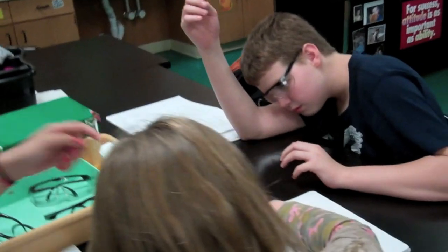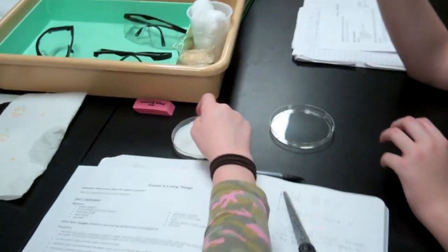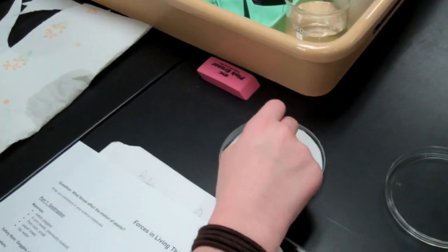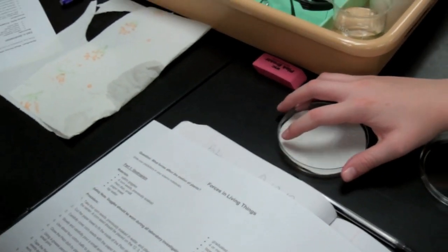Once you have your cut out piece of filter paper or paper towel, simply place it over your seeds and push it around to the edges so that it stays secure and also keeps the seeds secure to the front side of the petri dish.